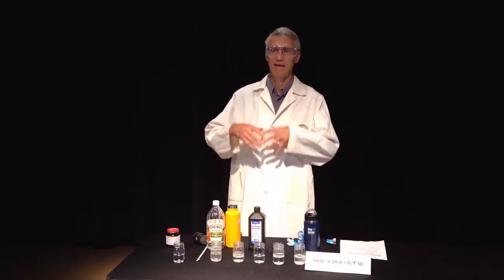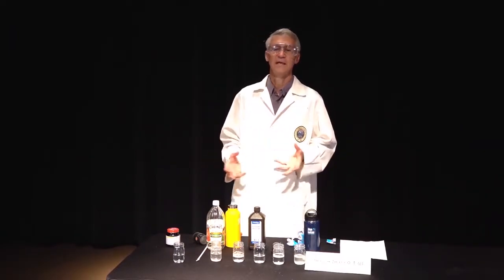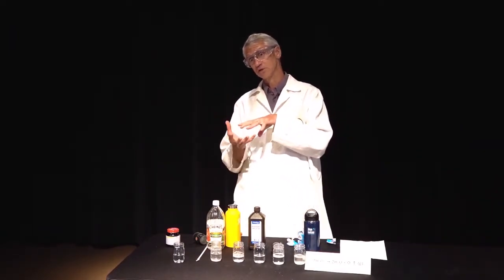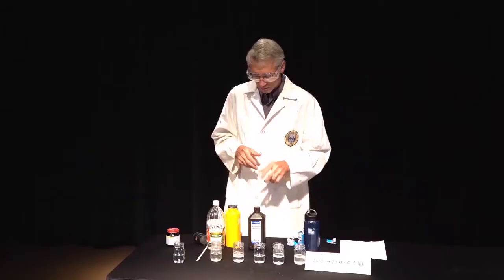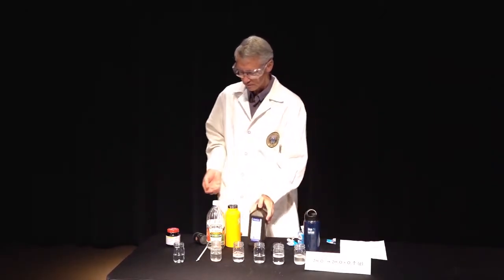And there are some very dramatic ways of doing that. For example, if you put a material called potassium permanganate into this, it will foam very rapidly. And if it's a 30% highly concentrated form, it'll make a lot of heat. And if you put a little bit of dishwashing detergent in it, it'll make a nice big foamy tube that flows out of your flask. But that would be a little more advanced than today's lesson, which is just going to use this 3% version.